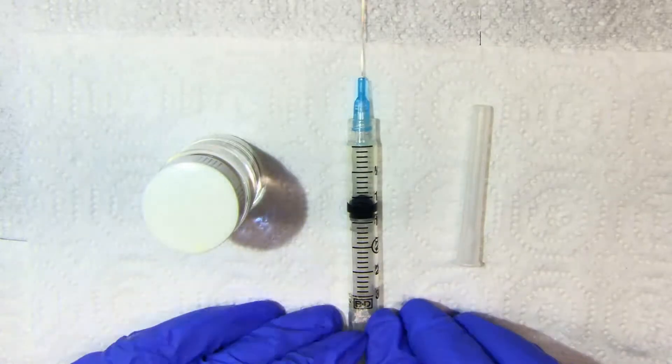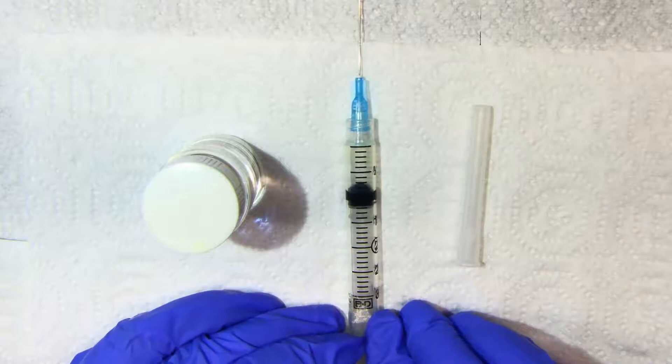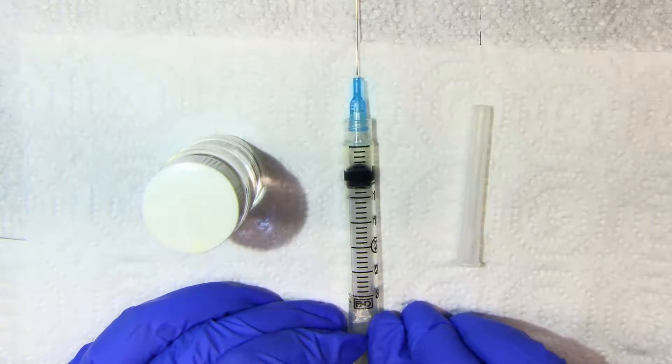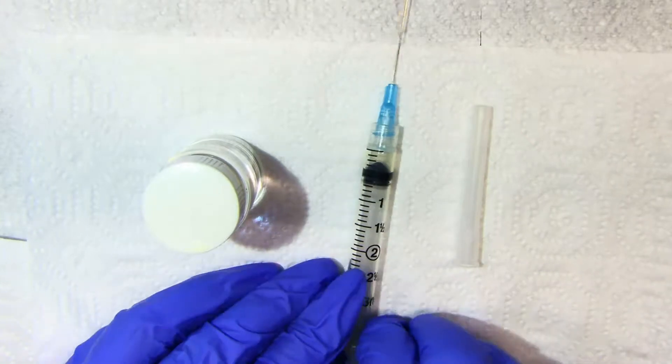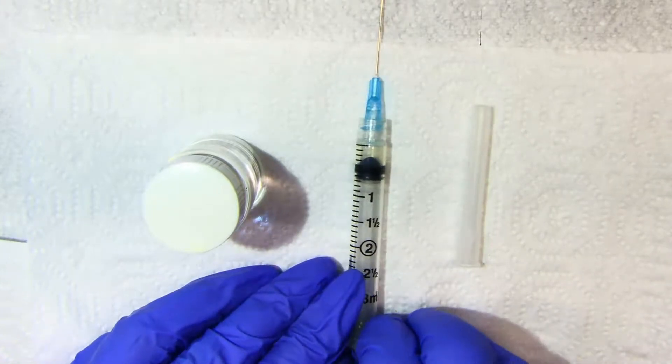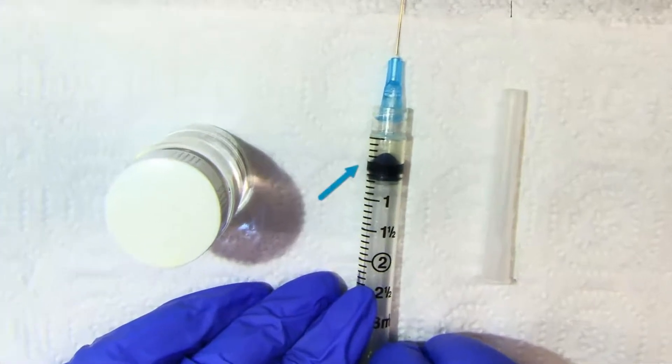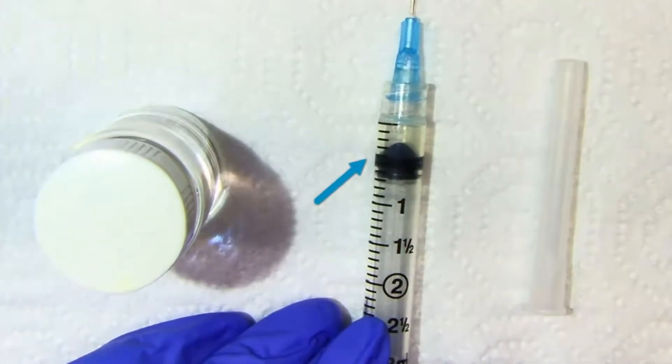So, if I were going to get it to 0.4, it would be right there. If I tilt it this way, you can count how many graduations down that part of the stopper that's touching the walls hits.